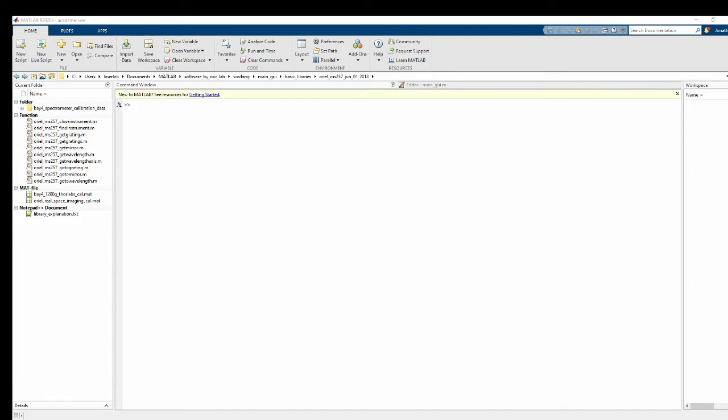Hello. Today I'm going to be showing you how to add a new instrument to main GUI. The first thing you want to do whenever you want to add a new instrument to main GUI is just create the basic library to do all the low-level commands that you want to do with whatever instrument you're working with. In this case today we're going to be adding in the Oriel spectrometer as a white light filter at the input of our imaging system.